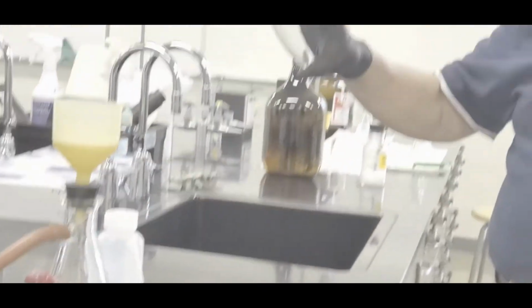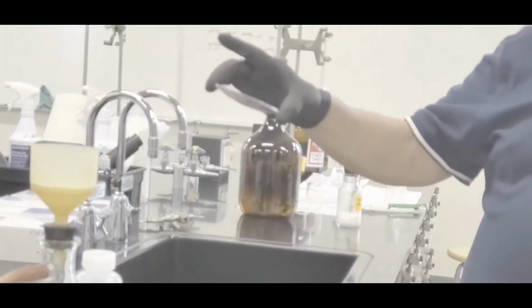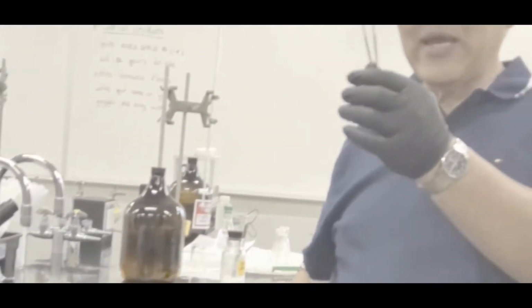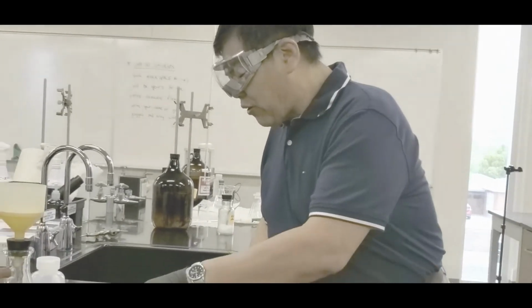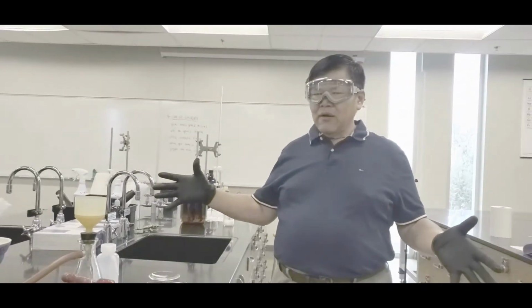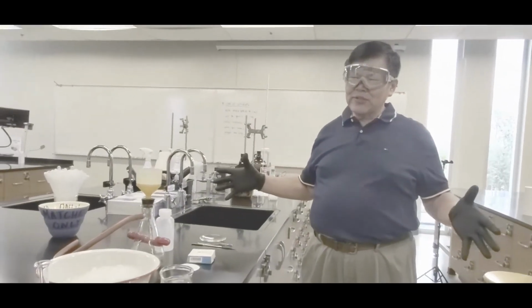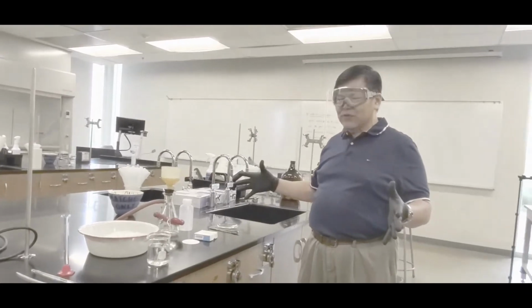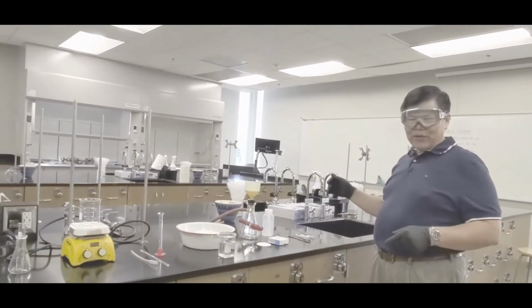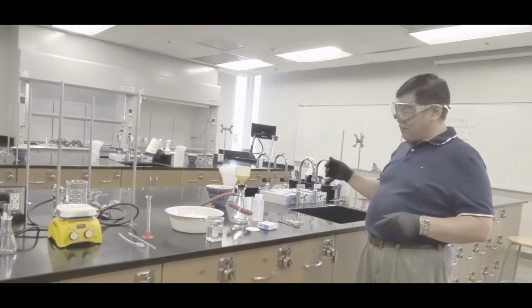Okay. Now the last bit of it is this one right here. You have a watch glass. That's for holding your product, okay, for the next time. Also a forceps, aka tweezer, as well as a spatula. Okay, so these are the appropriate equipment for the lab for the day. Okay, so this will be one more complicated synthesis for the semester. Hey, enjoy. When you go to organic, there'll be a lot more stuff.